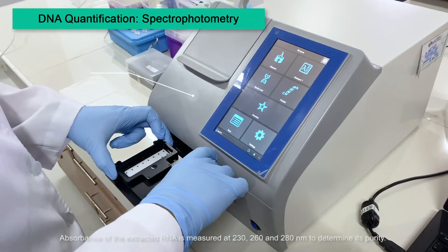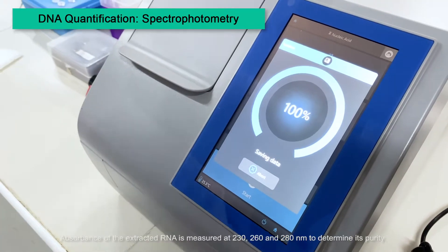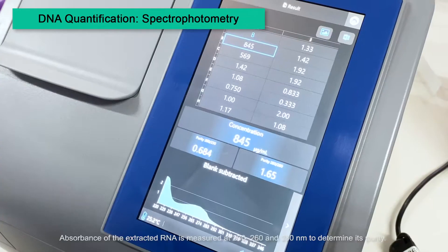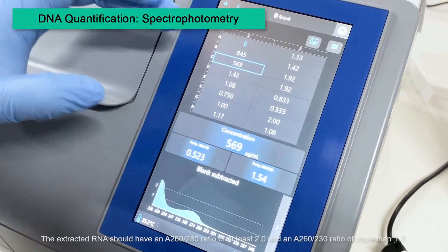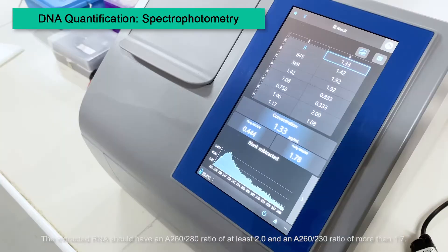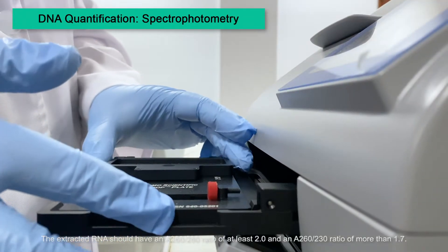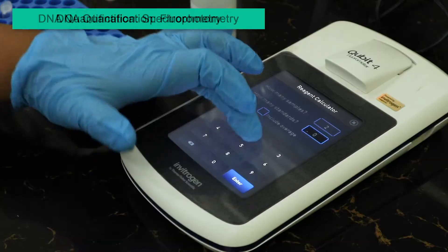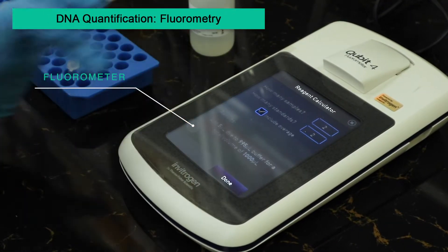Absorbance of the extracted RNA is measured at 230, 260, and 280 nm to determine its purity. The extracted RNA should have an A260/280 ratio of at least 2.0, and an A260/230 ratio of more than 1.7. The quantity of the extracted RNA is checked via fluorometry.